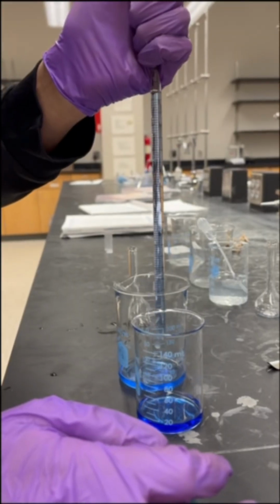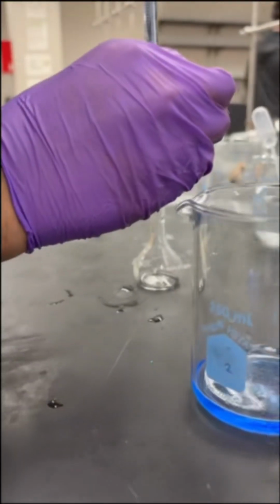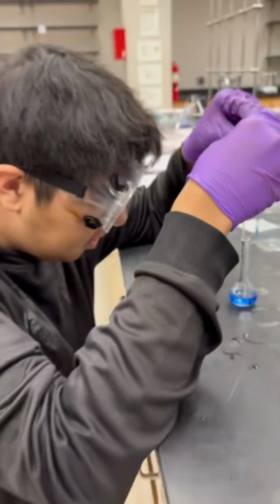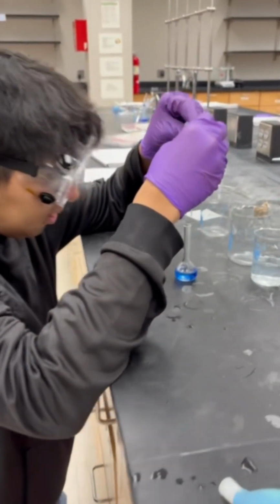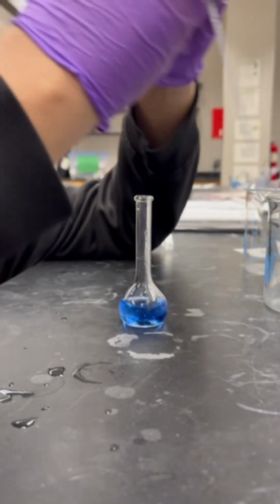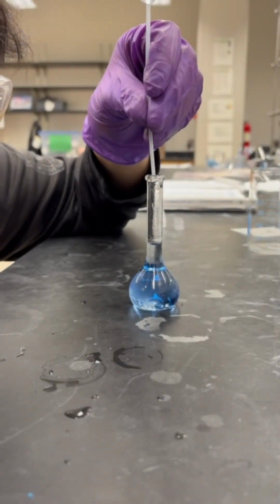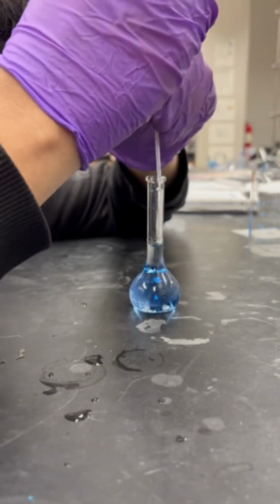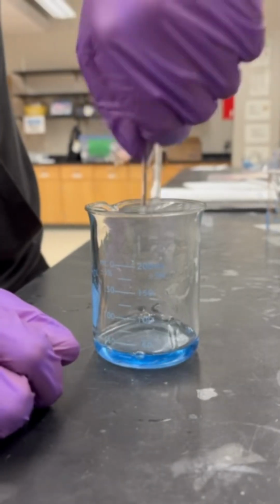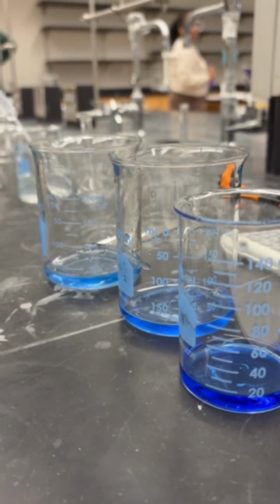We then perform our second dilution. As you can see, we are pulling only 10 milliliters of our first dilution to make our second dilution. It is very important that you consistently take the same drawn volume, or V1, and ending volume, or V2. If you do not, you will have a harder time calculating the unknown molarity of your dilution.